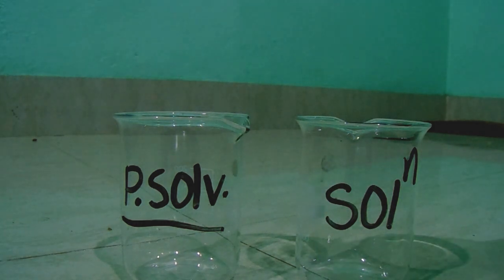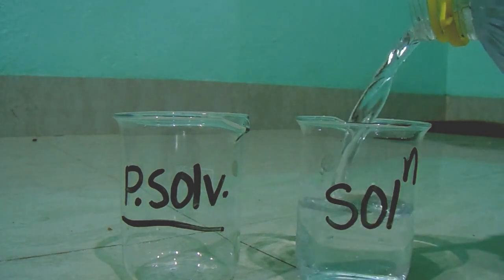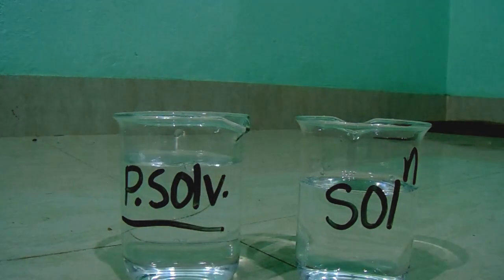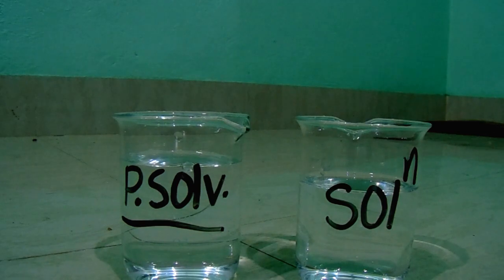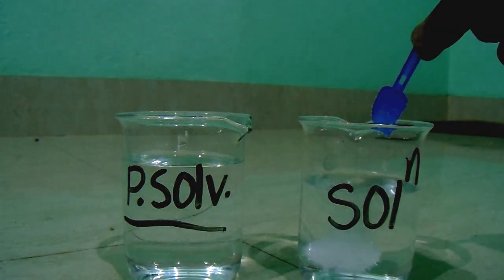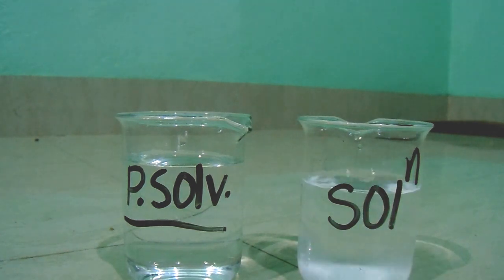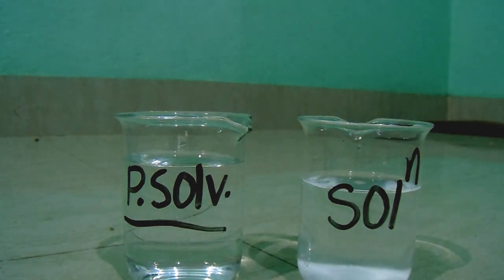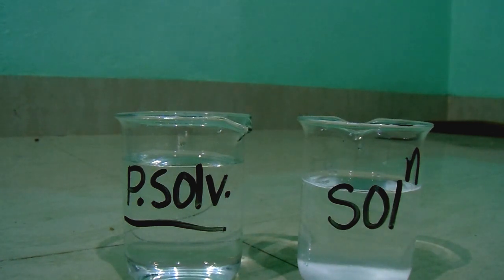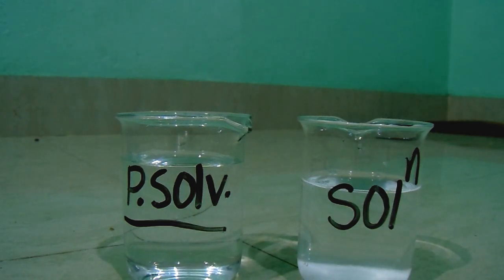Good morning everybody. Today we will demonstrate the depression in freezing point. We have taken two beakers labeled as pure solvent and solution, and added pure water to both of them. We will add salt to the beaker labeled as solution to get a true solution. After experimenting, we will also proceed towards the derivation of the depression in freezing point to prove it as a colligative property.